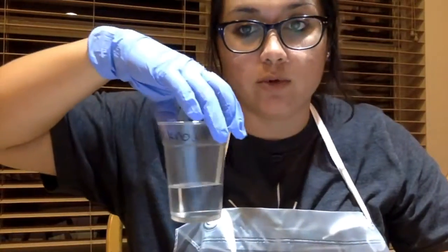So for activity 2, I will be using the unknown solution prepared in the preparation part of the lab, where, let me describe what the unknown has.